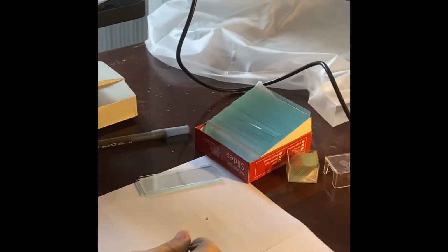As you can see, there are bubbles in the specimen. These are air bubbles and they're surrounded by a black circle. You can identify them, they're all over the place. But you will find patches of cheek cells, and you need to find one that you can isolate because some of them are on top of each other because of the nature of collecting the sample.